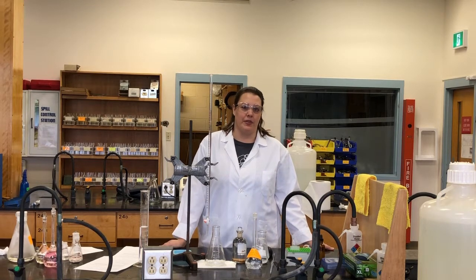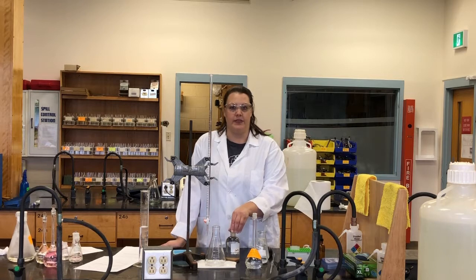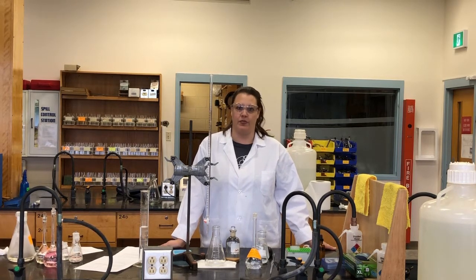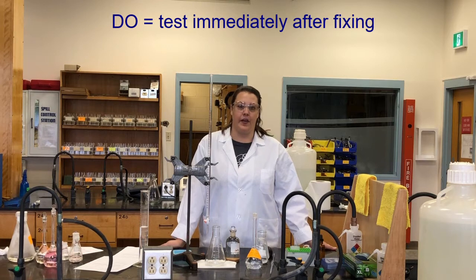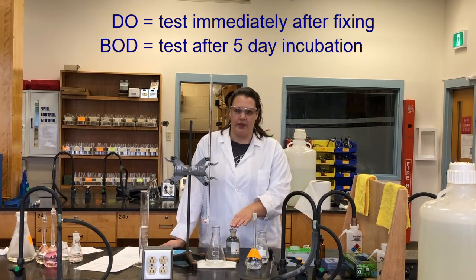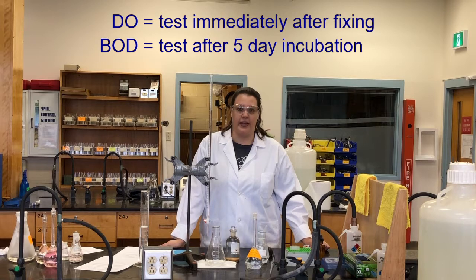So you may remember in the last lab when we took our sample bottle and we fixed it. So we added manganese sulfate and the Winkler's reagent to it. And then one of the samples we tested right away for dissolved oxygen, and the other I mentioned I was going to put it in the incubator for 5 days. So this is our sample after it has sat there at about 20 degrees Celsius for 5 days. So now we're going to test it again using the exact same procedure for the biochemical oxygen demand.